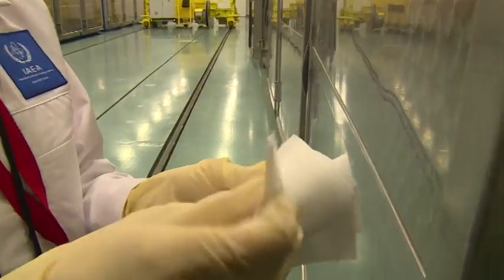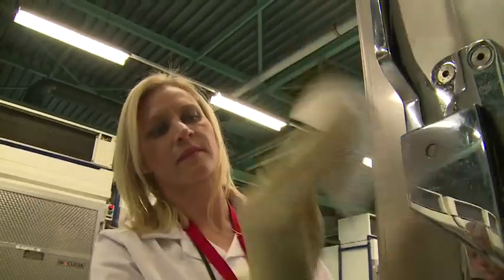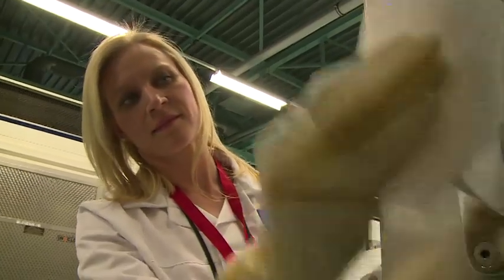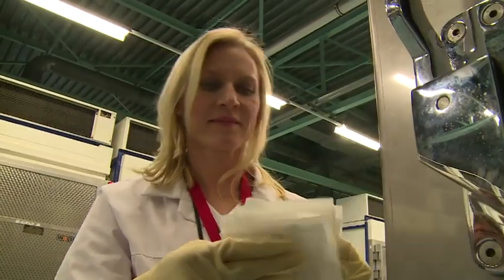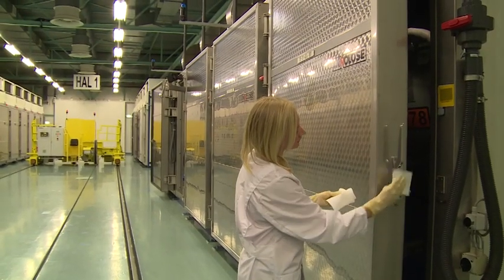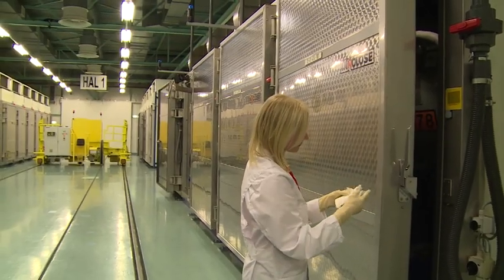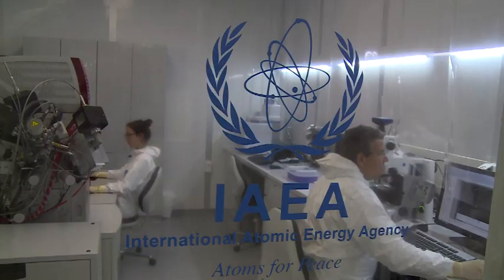We have basically six replicate samples, of which one stays at the facility as a reference. The remaining five are sent to the IAEA in Seibersdorf, and we analyze one or two of those.